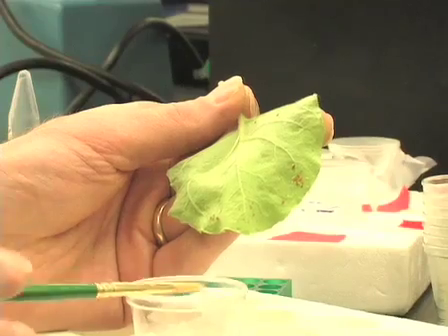Hi, my name is John Ramsey. I'm a grad student in the lab of George Jander at the Boyce Thompson Institute for Plant Research. Today, I'm going to show you a procedure to measure the toxicity of plant metabolites against aphids.